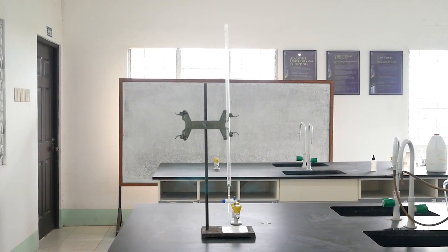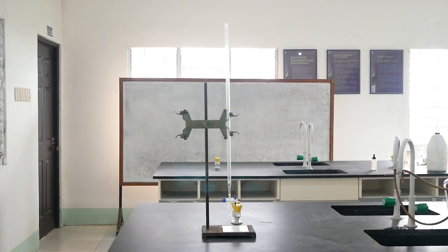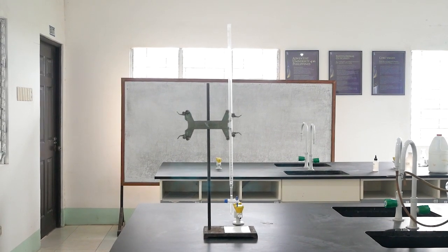Hi! Welcome to the Adventist University of the Philippines Chemistry Laboratory. What you are looking at is the setup for the titration.